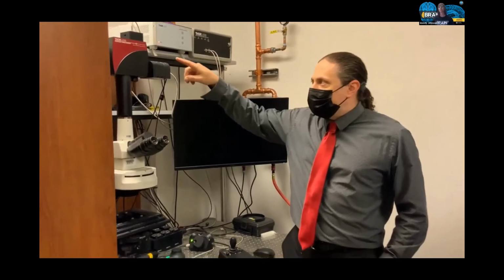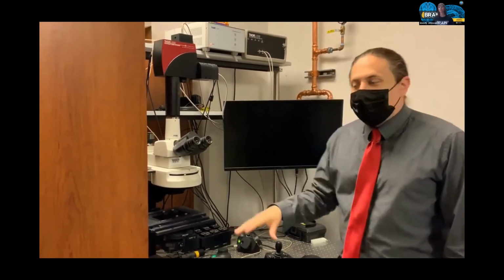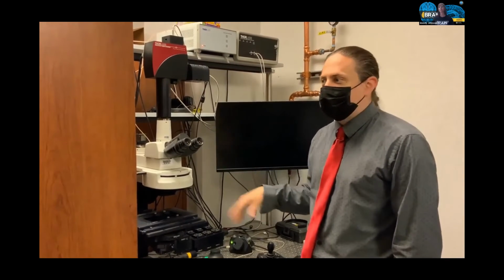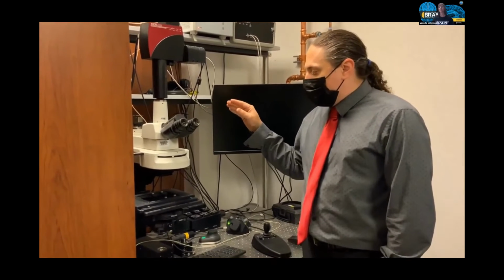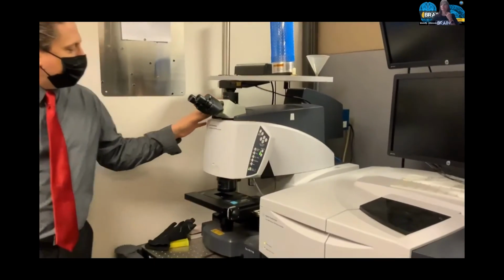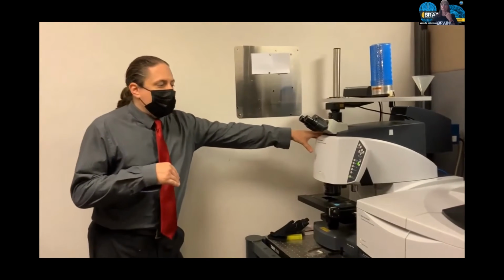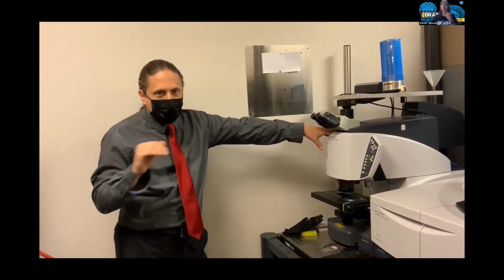So this is a resonant galvo system. So it's designed to be able to image very quickly. We have optical objectives that are very large working distance for imaging very thick samples, like those that you would get with clarity or using techniques like expansion microscopy. This imaging system is an Agilent FTIR microscope. So this is an infrared imaging system that we primarily use to image two-dimensional samples, usually tissue biopsies.